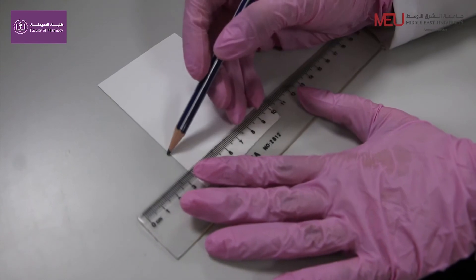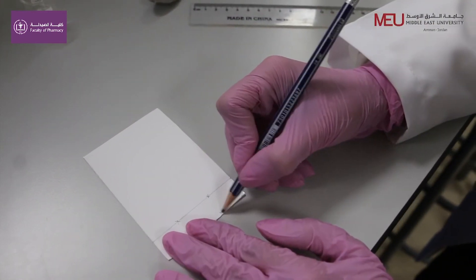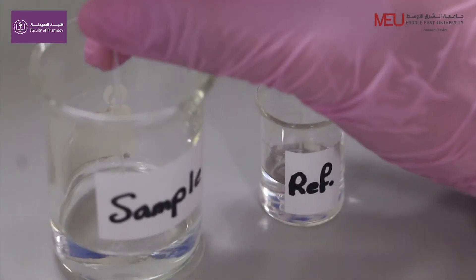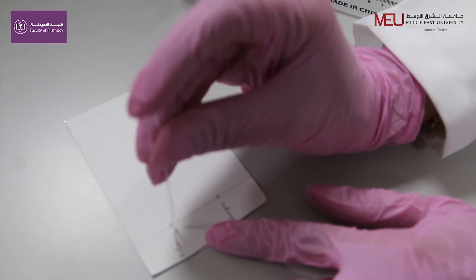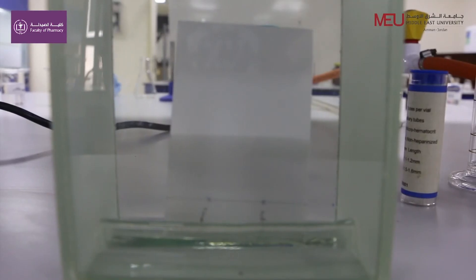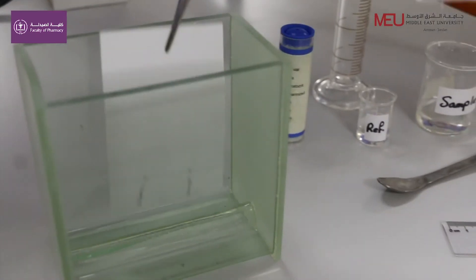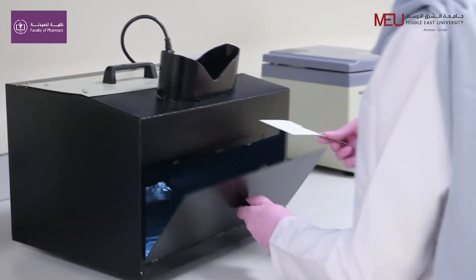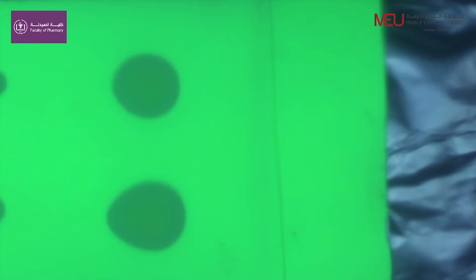Prepare your TLC as instructed and develop in the solvent system. Allow the solvent to evaporate from the plate. Using a UV lamp, visualize the spots. Analyze your results and calculate the RF values.